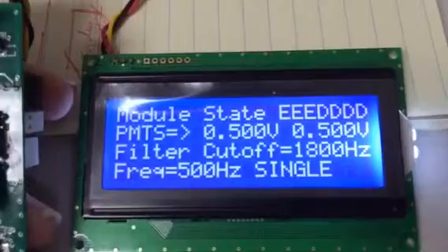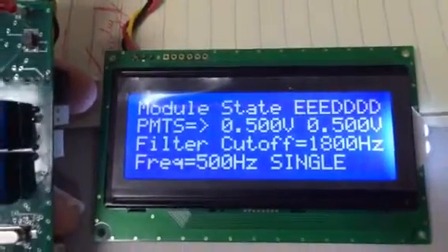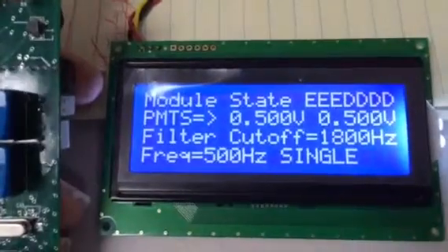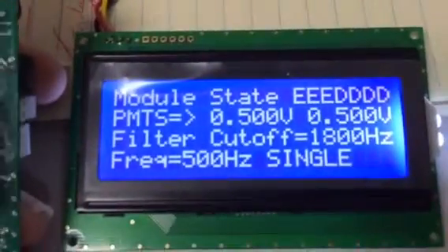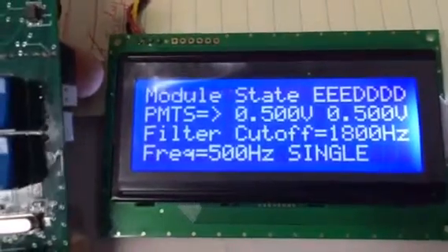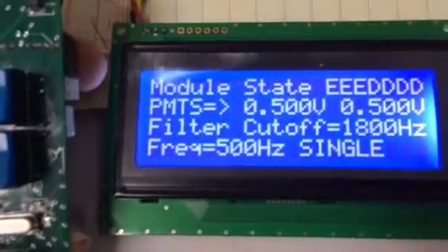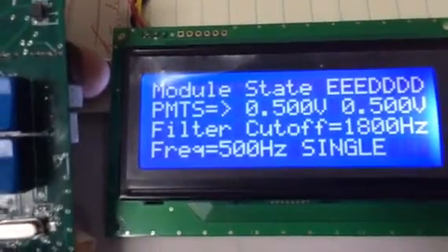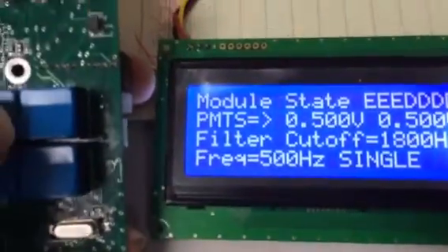To be able to specify individually the maximum current for each module, for different populations of different kinds of modules, we have added a feature to be able to do this on a module by module basis. This is a parameter that gets saved. So on subsequent power-ups, the parameter will be preserved.